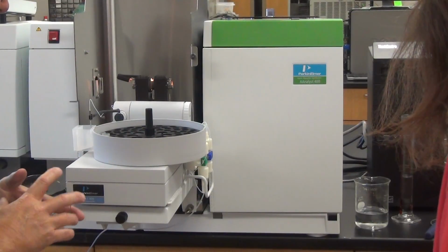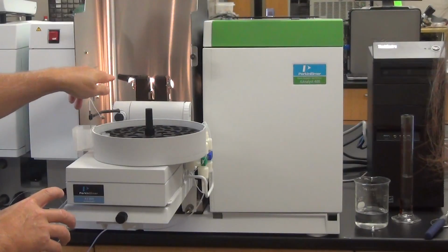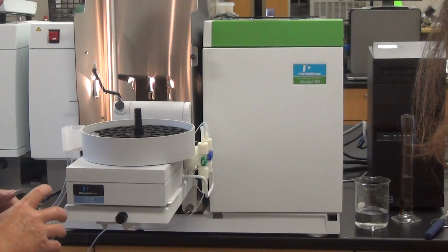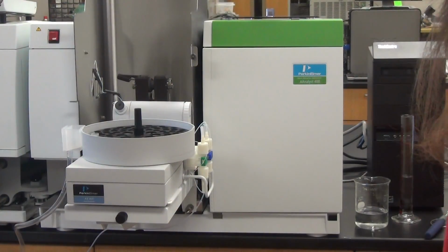Then we're going to do atomization. There's atomization. You see go up there. That was when that took over. And then clean out. So you hear the cooler come on? And it will get faster and slower depending on what temperature it senses. And then we have a peak.